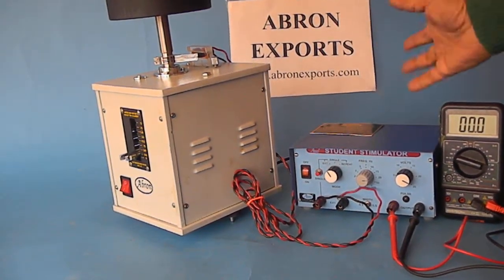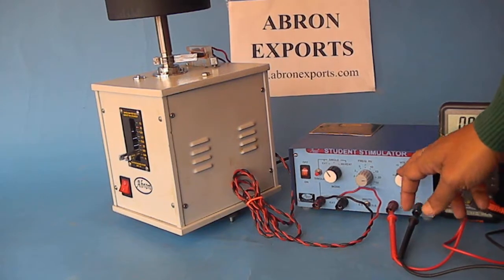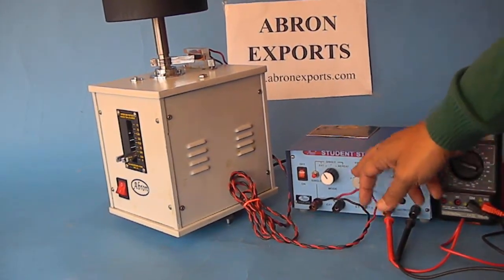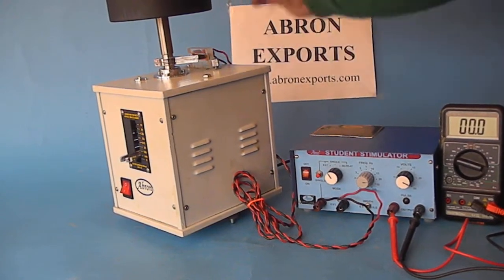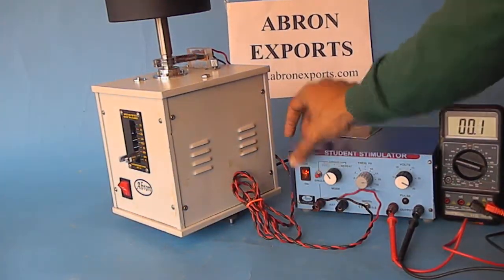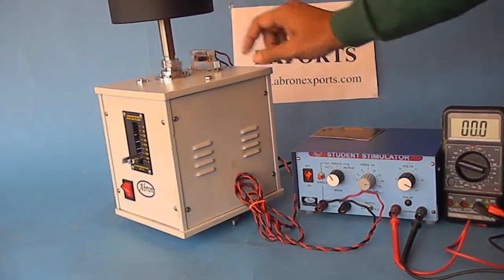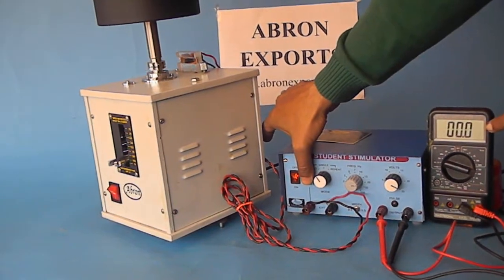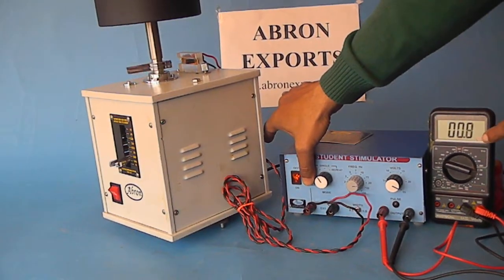Connect these wires and select the speed. Now this is touching, we have adjusted this. When you press it you can see now the pulse is going. You can see on every touch the pulse is coming to this, you can see this also in the red indicator.